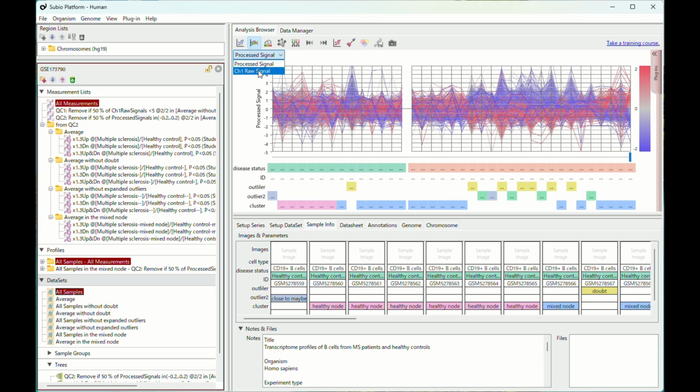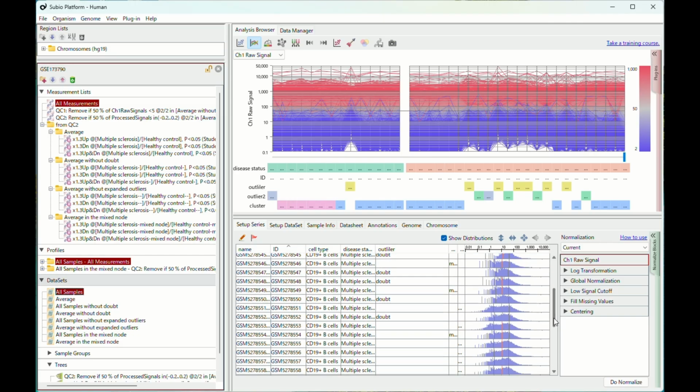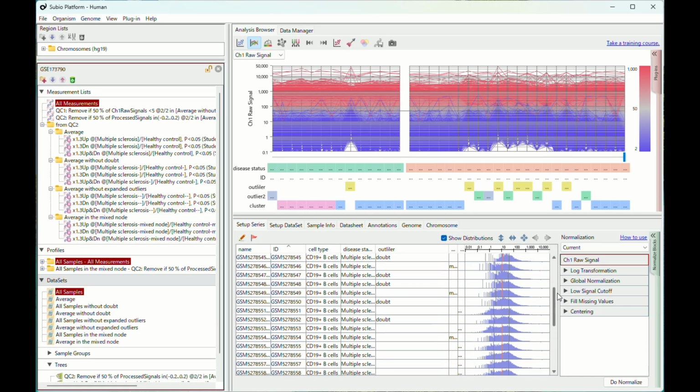You can switch the visualization from log-2 ratios against the average expression level to the raw data, in this case, the CPM. You see, those samples lack very low CPMs. CPM, counts per million reads, is a normalized measure of gene counts. If the total number of reads is insufficient, CPM is elevated due to normalization.